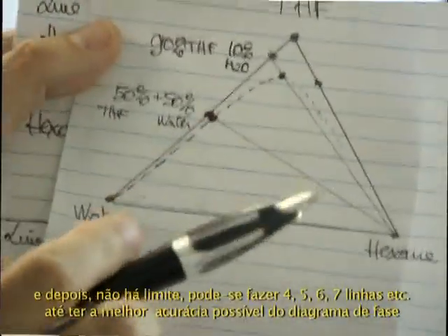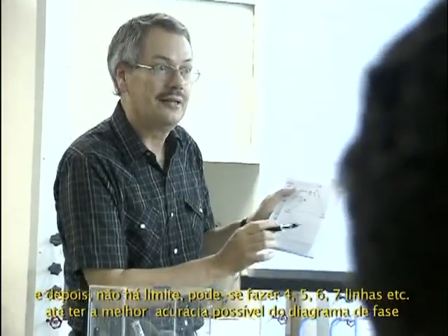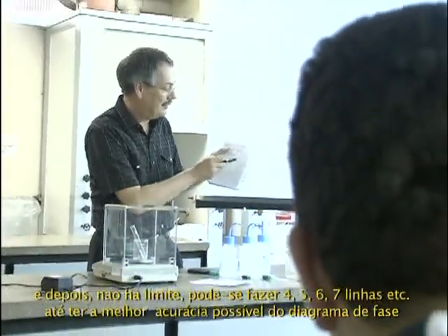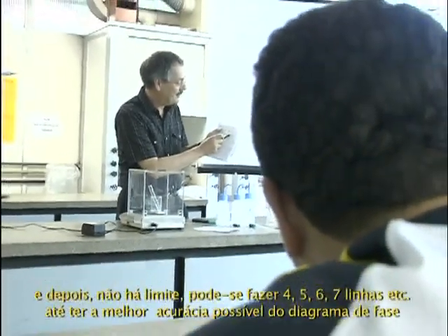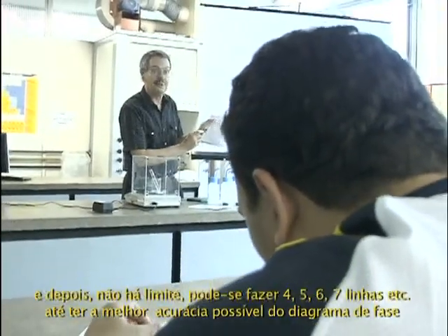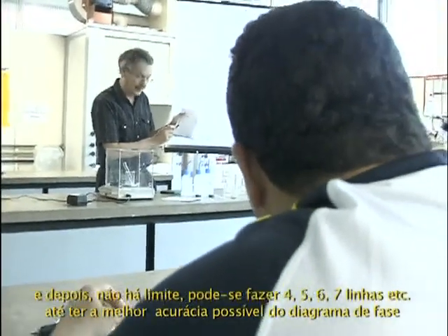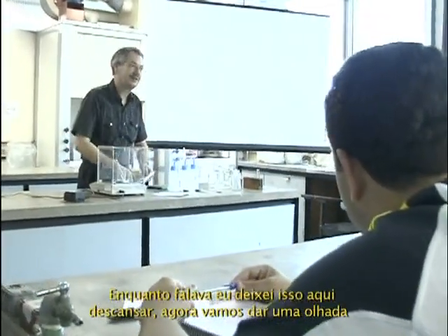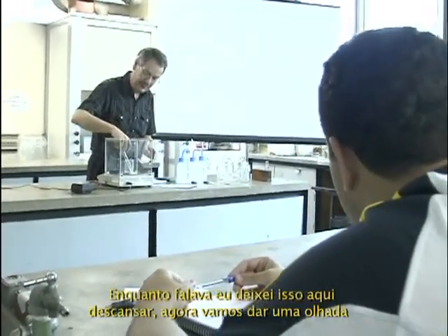And then there is no limit. You can do 4, 5, 6, 7 lines to have the most accuracy possible on the phase diagram. While I was talking, we let this one rest. Let's have a look now.